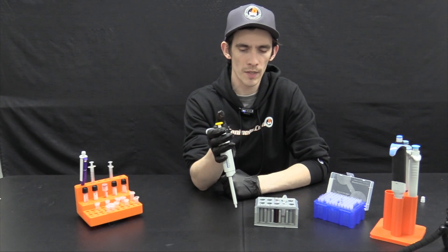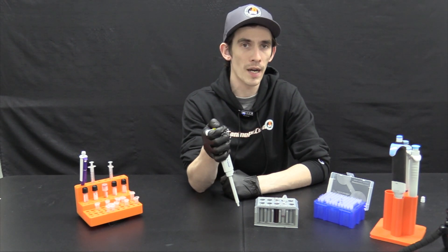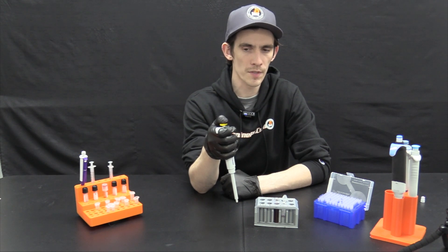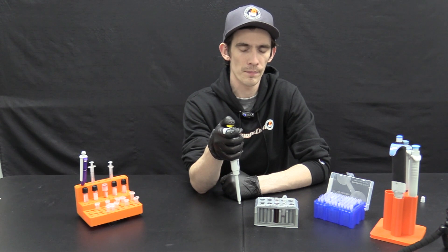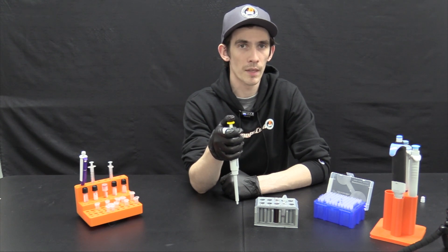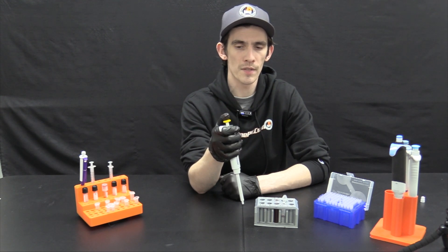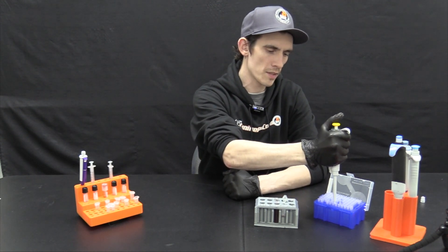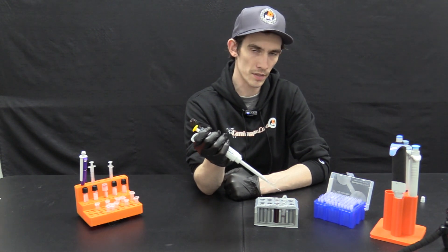Let's demonstrate what happens when you aspirate from the wrong position, which would be the bottom. You need to aspirate or draw up the liquid from the first point of resistance, also known as the first stop. Not drawing the liquid up from the first stop will result in invalid results. Be sure to master this step so that you can trust your results. Apply a new pipette tip, making sure it is firmly placed by applying some pressure on the rack, but not too much.